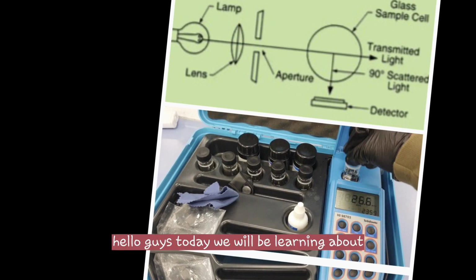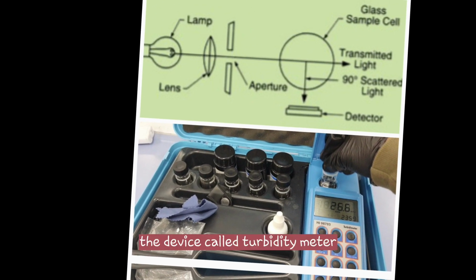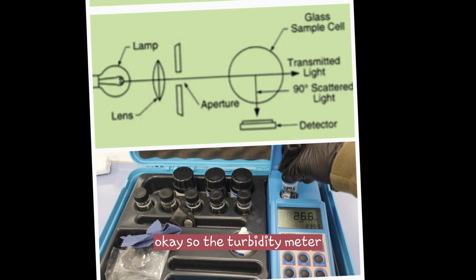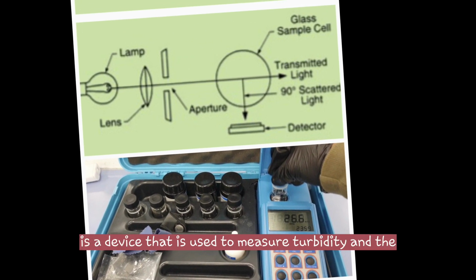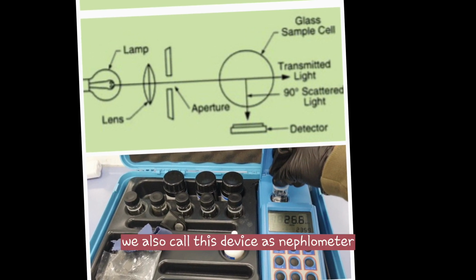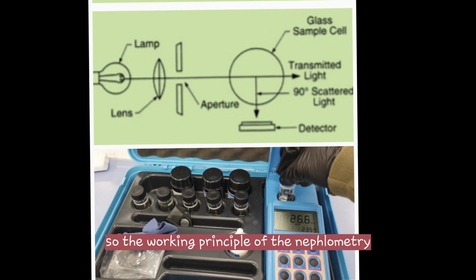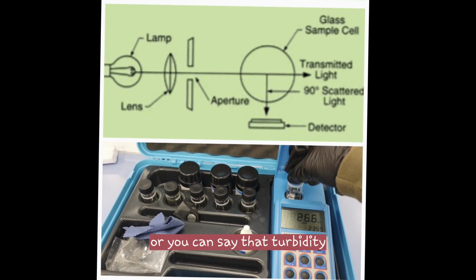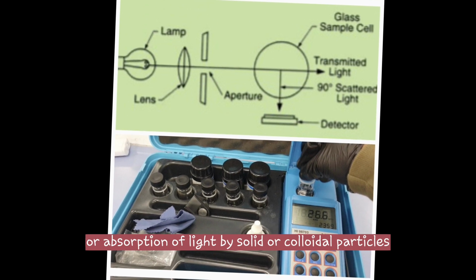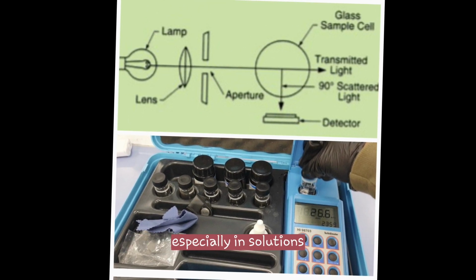Hello guys, today we will be learning about the device called turbidity meter, and shortly we'll also know about what is turbidity. The turbidity meter is a device that is used to measure turbidity, and we also call this device a nephelometer. The working principle of nephelometry, or turbidity, is based on the scattering or absorption of light by solid or colloidal particles suspended in solutions.